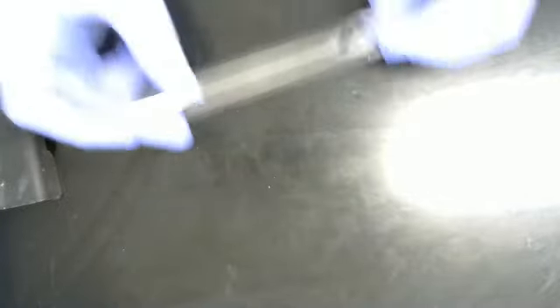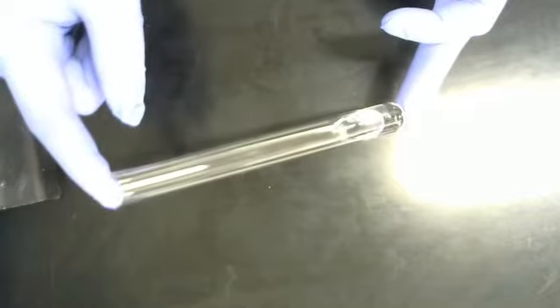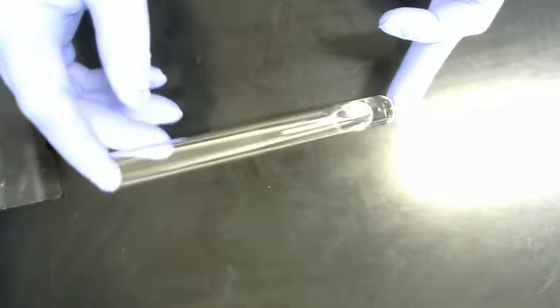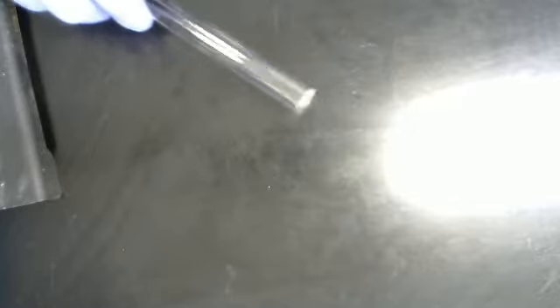First things first, a small spill, which is any spill that is from really any amount up to around nine milliliters. That is a small spill, which we are going to show. This is a test tube with a small amount of water in it. This would be considered a small spill. Now what makes a small spill easier to clean up is that it's not that big. So I've just made a spill. This is on the larger end of a small spill.